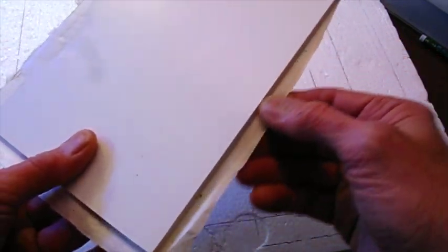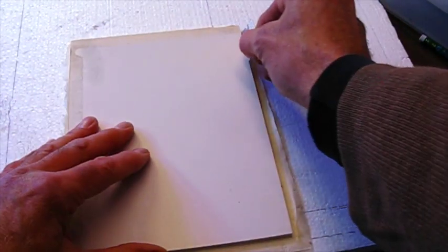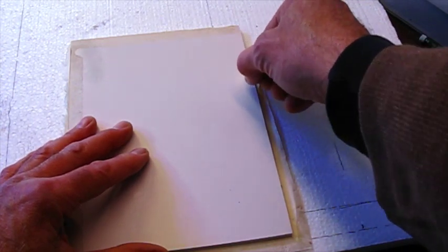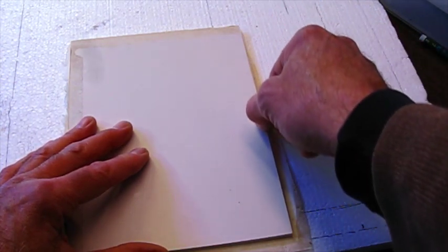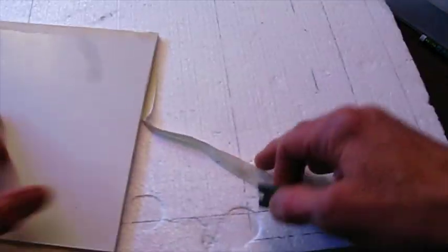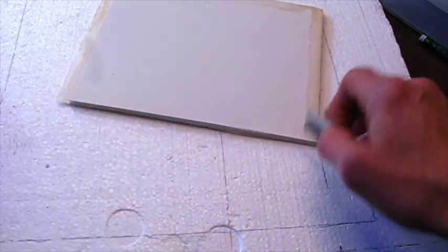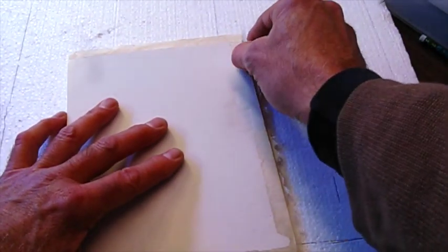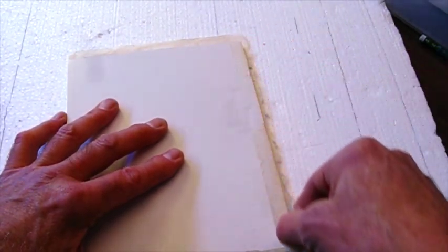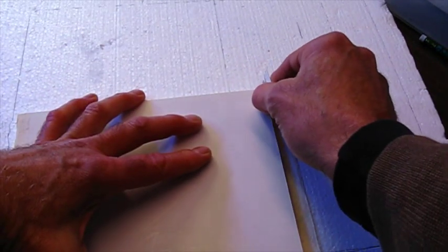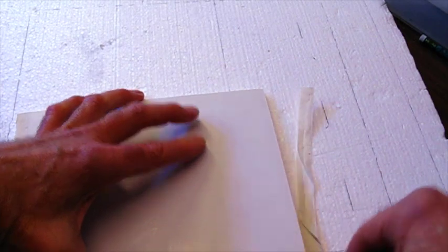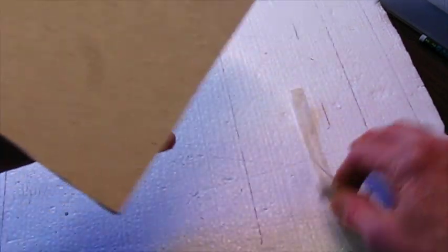Now I'm going to take a piece of styrofoam. And the paper is over the edge of this a little bit, so I'm going to use a razor blade to trim it.